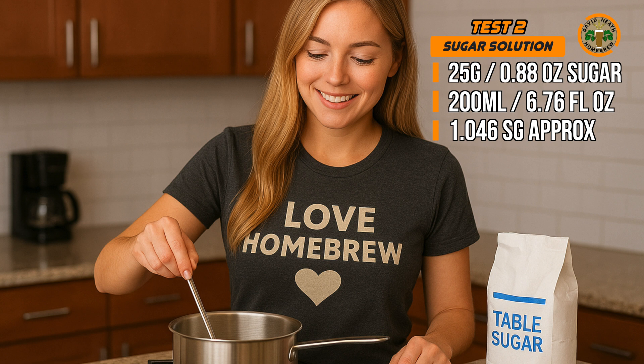That's the real key to brewing accuracy. Some brewers prefer this type of test because it simply tests the hydrometer within gravity levels that are more relevant to beer. I believe that both methods have their place personally — and two tests are also better than one in fact.